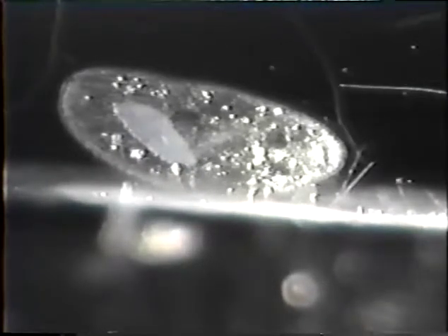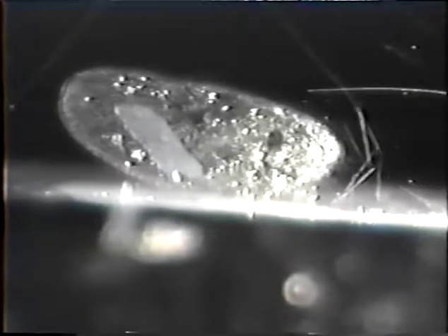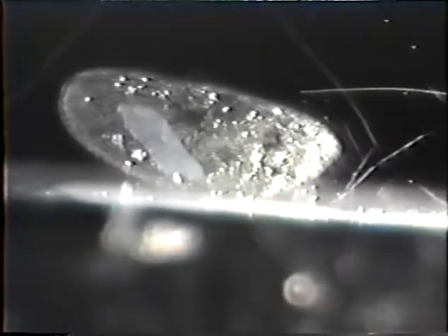See, he's just starting to open a few areas within the cell wall here. These dark spots are starting to occur within the body. Apparently he's blown out on the back side of the organism.